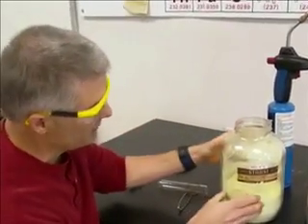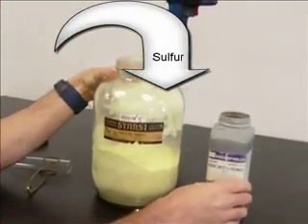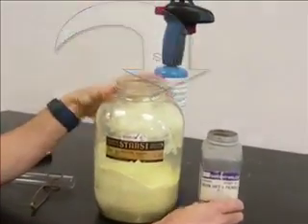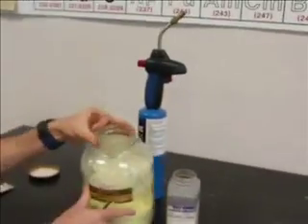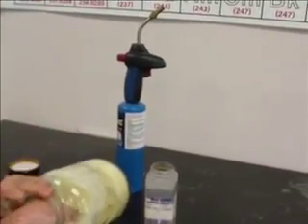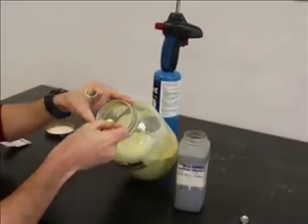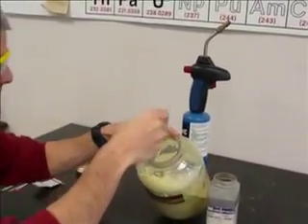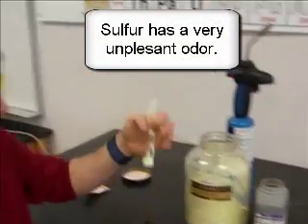The reaction I'm going to work with is I have sulfur, elemental sulfur, right here, S. I think it's S8, isn't it, Mr. Sanders? It is. And I have iron metal. So what I'm going to do is take into this test tube some of my sulfur. This is a good thing about sulfur, isn't it, Mr. Sanders? That is, but it smells lovely, doesn't it? Oh, woo! So I have some sulfur in there.